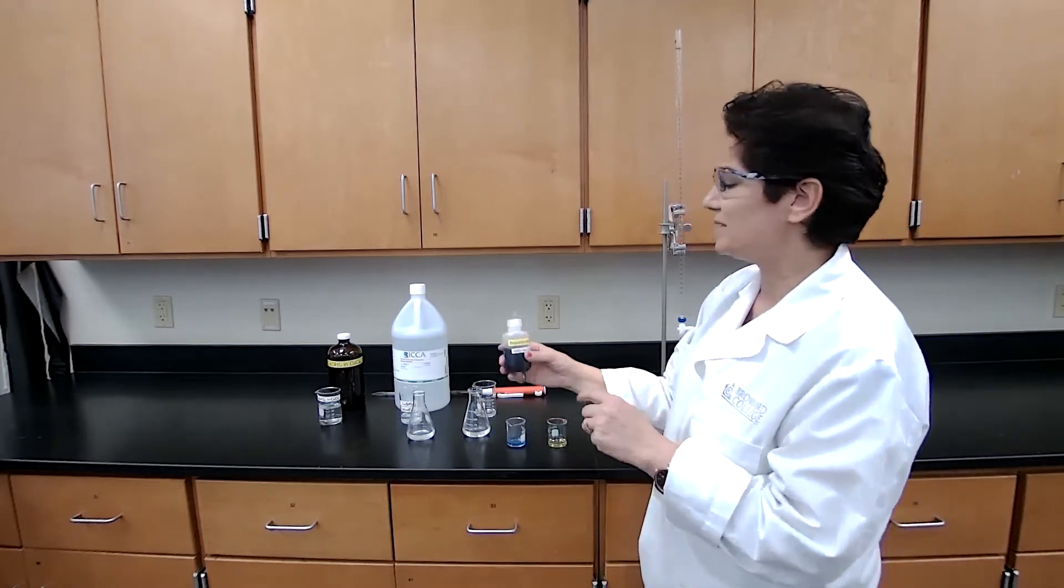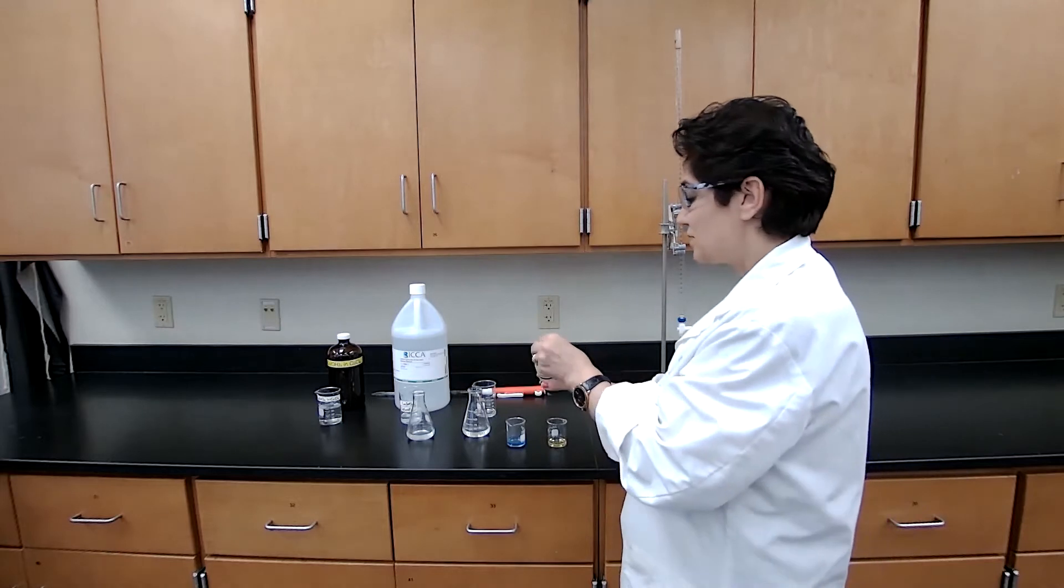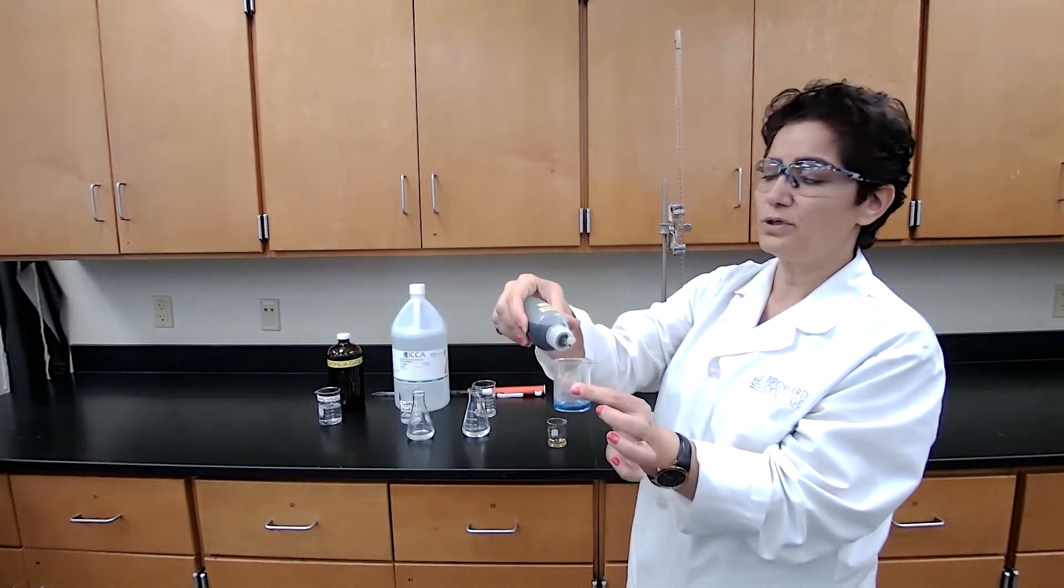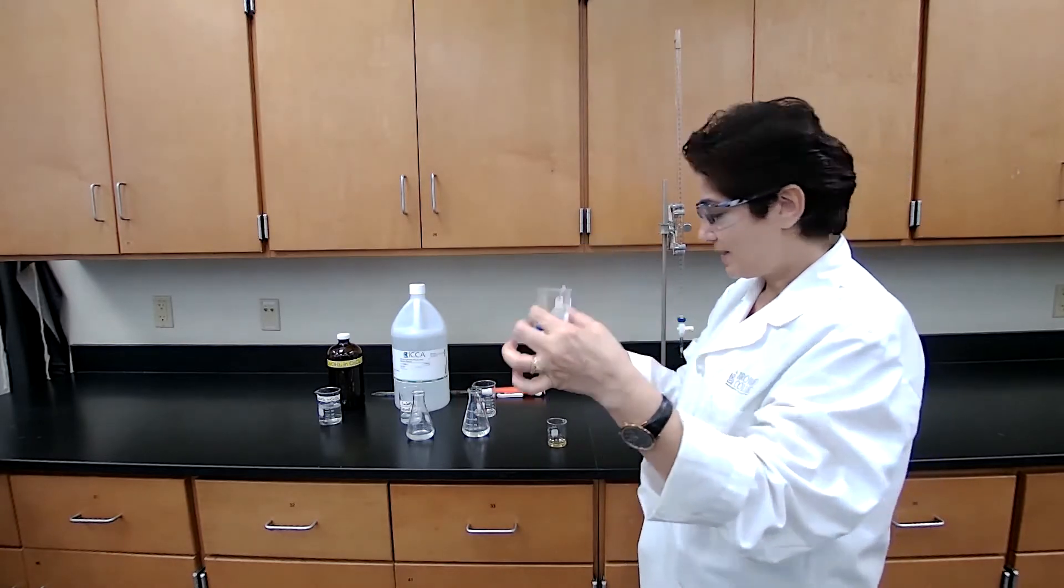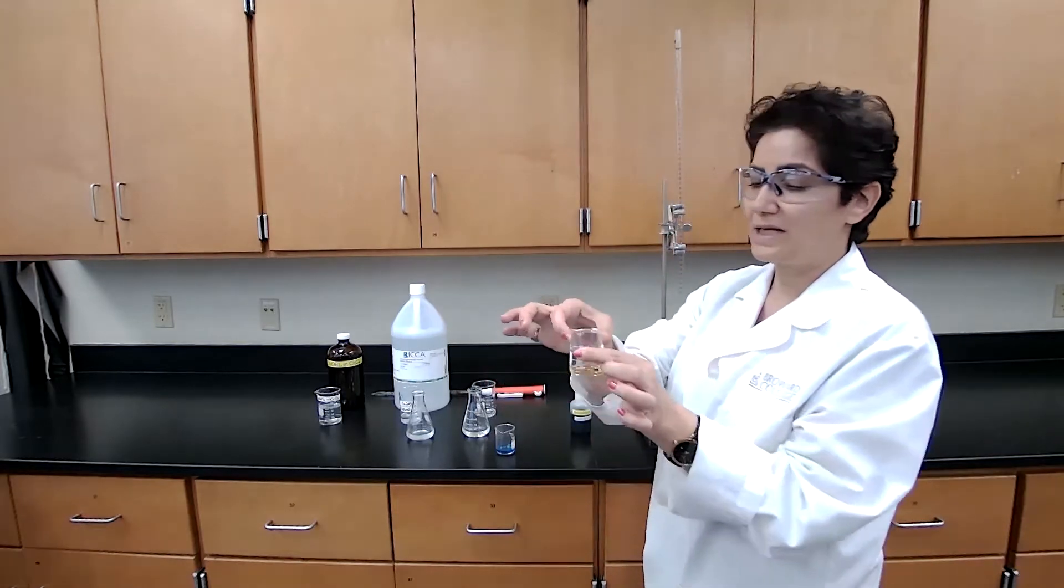The indicator which I'm using is the bromothymol blue, and this is going to be showing the blue color in a basic solution. And the acidic solution is going to be this yellow color.